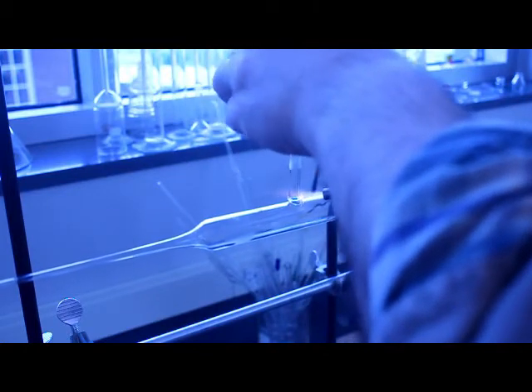Here I am using a graphite rod to make my glass hole a little bit more symmetrical and it takes me several attempts. You'll see in a second when I make the seal between the smaller tubing, the tubing I'm going to seal on to the 24 millimeter I want to say it's about eight millimeters in diameter or thereabouts, I really didn't measure it. I already had some stock cut, but when I do it because of just not being in practice and the position of the camera I end up being way off-center and that leaves a very large hole in the interface between the two pieces of glass, so I end up having to correct for that by adding more glass.